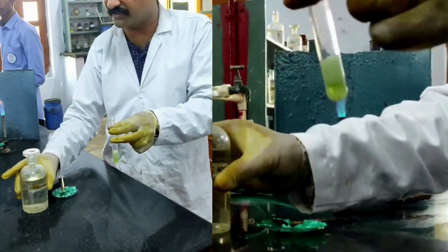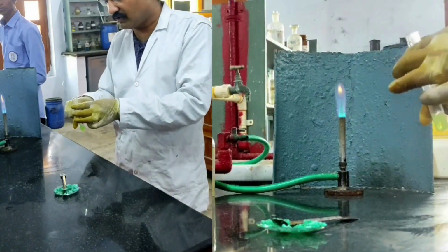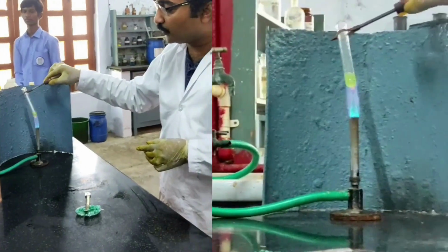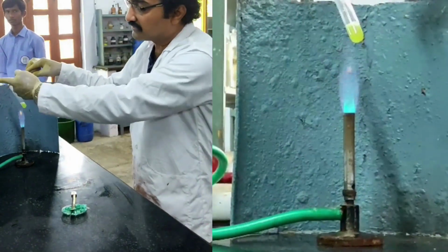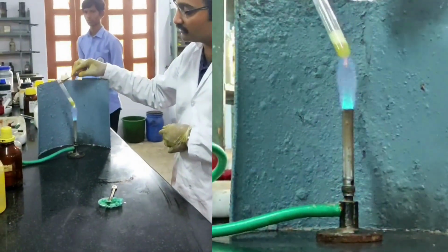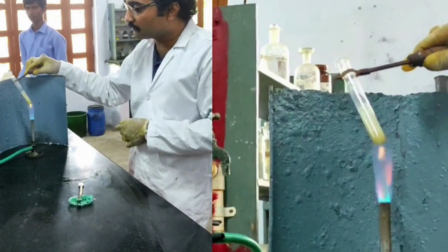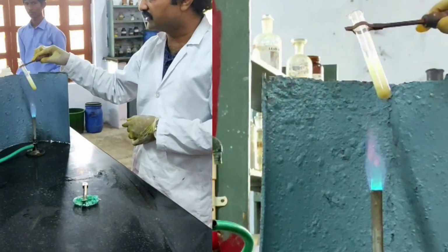Acid. Care must be taken while adding concentrated sulfuric acid because there is ethyl alcohol present here. Now these contents are heated. While heating, always try to project the test tube towards the sink area. That is the sink area. Therefore, direct your test tube towards the sink area. And you must be very, very careful while heating, especially when there is ethyl alcohol inside the test tube.